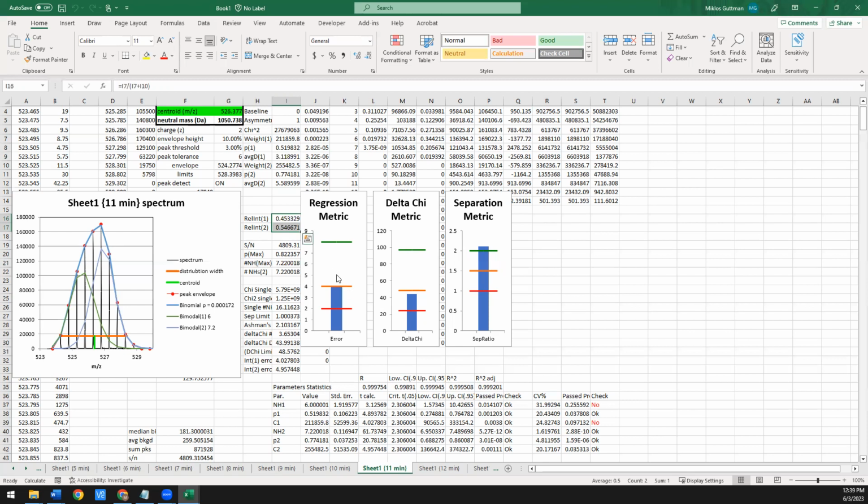Every once in a while, because of the fitting, if it's some kind of weird noisy data, it might get stuck in a local minimum. And I've seen a few examples where this is actually still higher than the green, but these are really low. So I would mostly go off this, but if these are low, they're kind of used as sanity checks to make sure that you're not over-interpreting something that was just in some kind of a weird minima during the fitting process. So let's see what this actually looks like for a well-resolved bimodal.